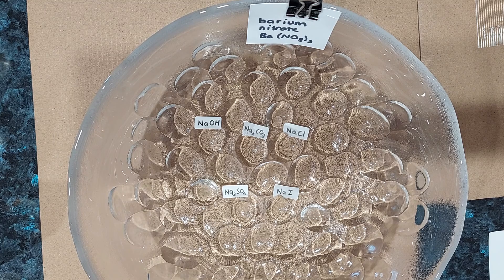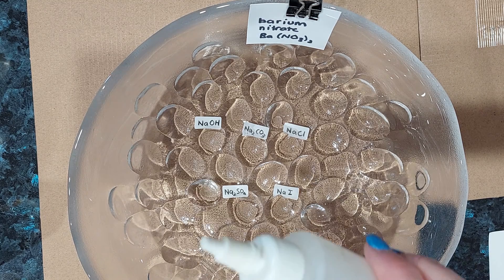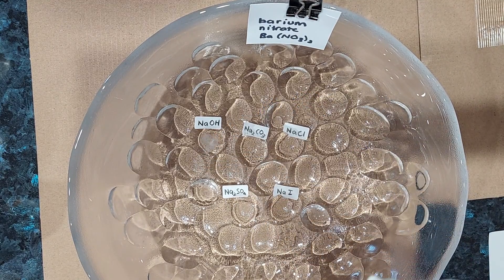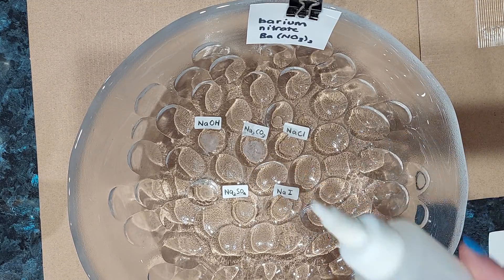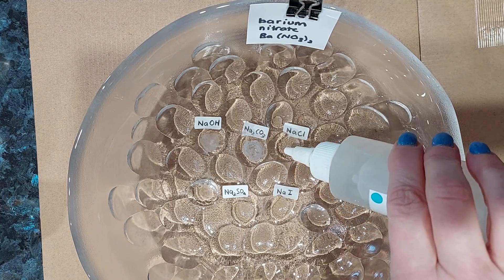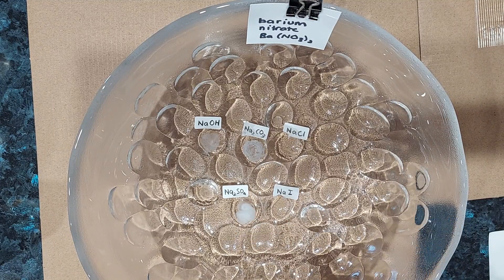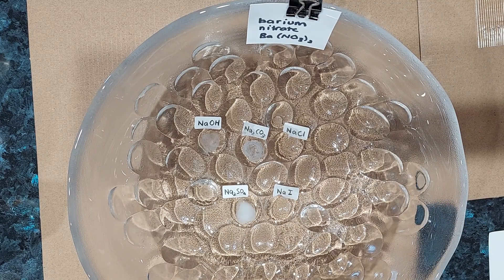Our next nitrate is barium nitrate. Barium nitrate and sodium hydroxide — a very fine white precipitate there. With sodium carbonate — again a white precipitate. With sodium chloride — nothing. Sodium sulfate — a white precipitate. And sodium iodide — nothing.